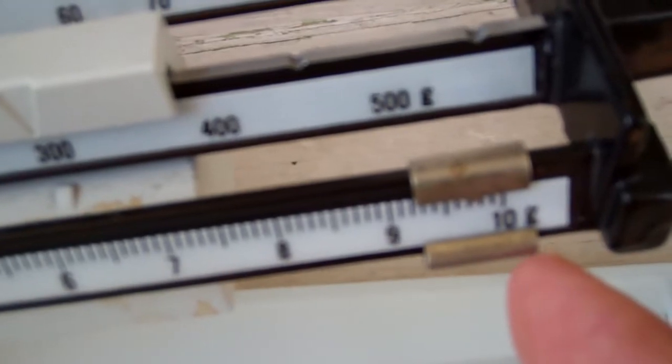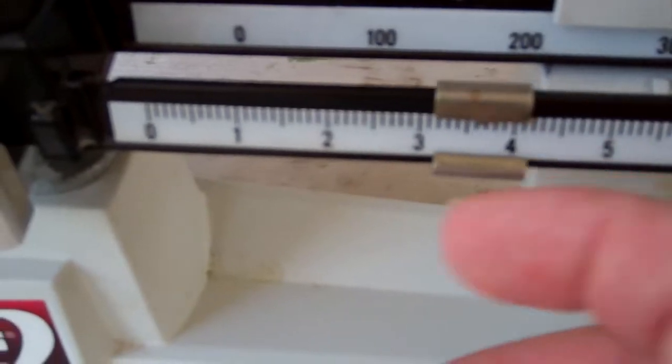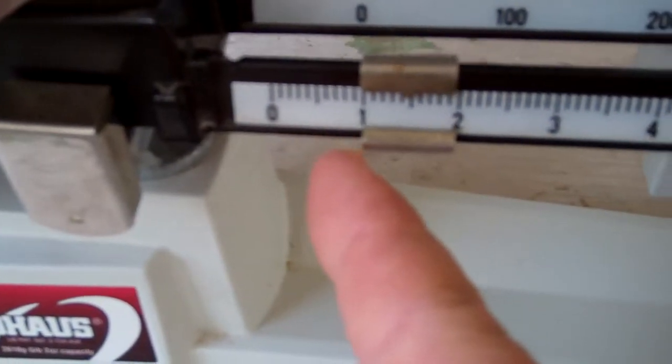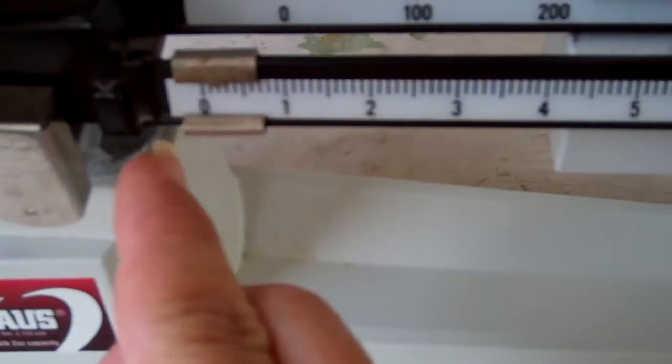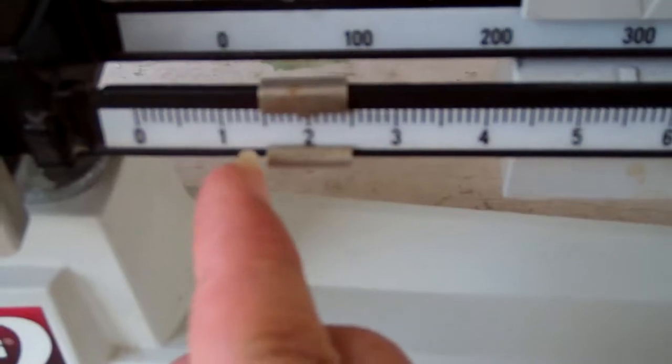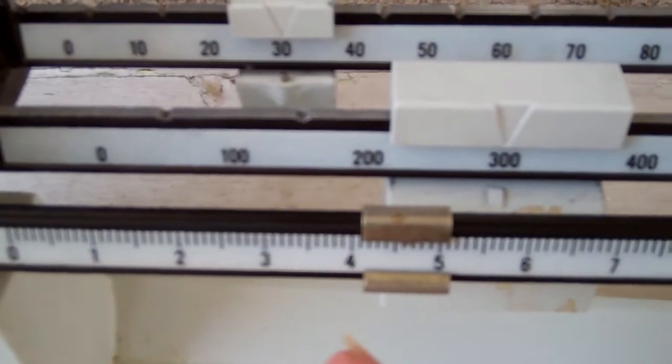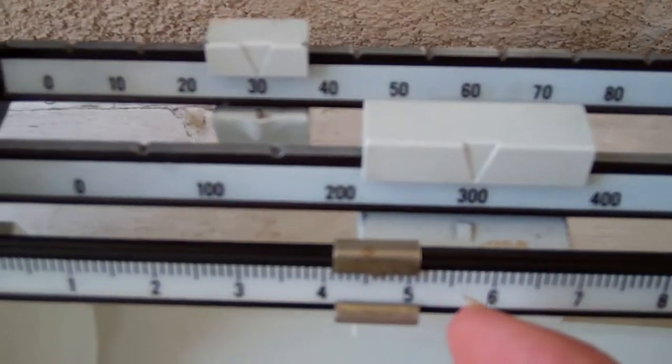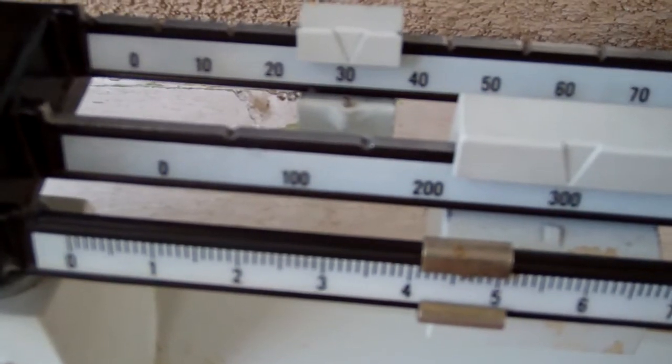Keep moving these around until you can get it just right. It always takes you a few minutes to figure out how to measure things. And then it takes a couple minutes to actually get it done.